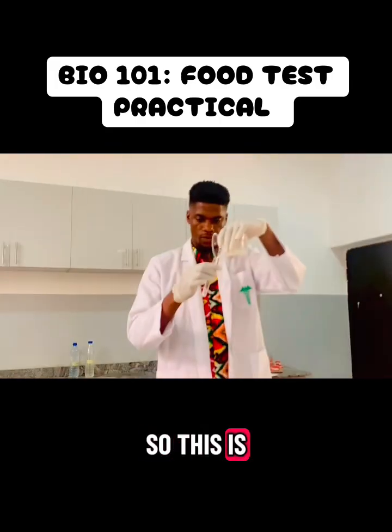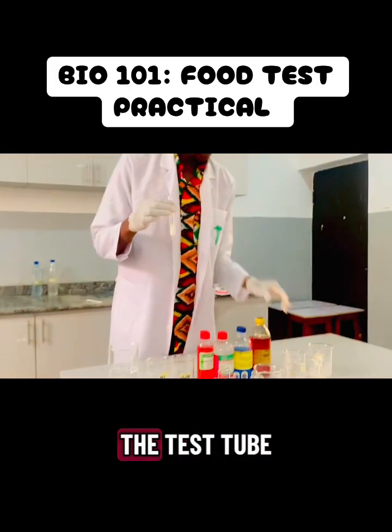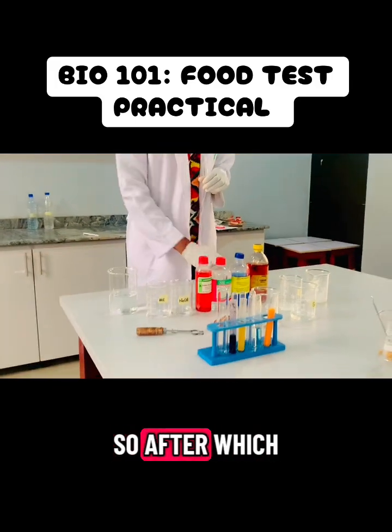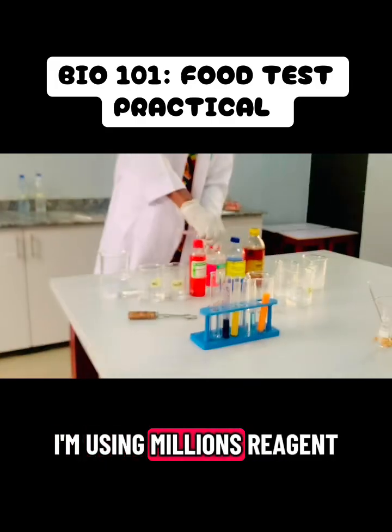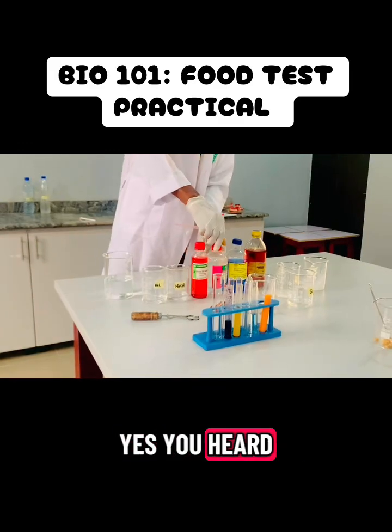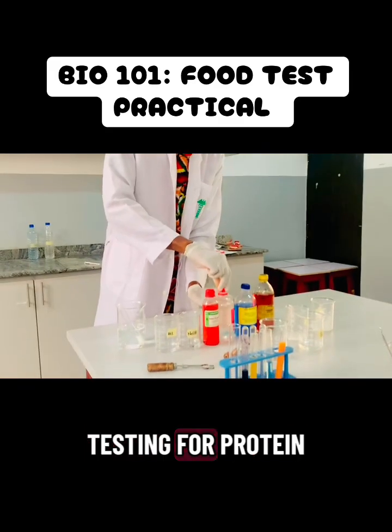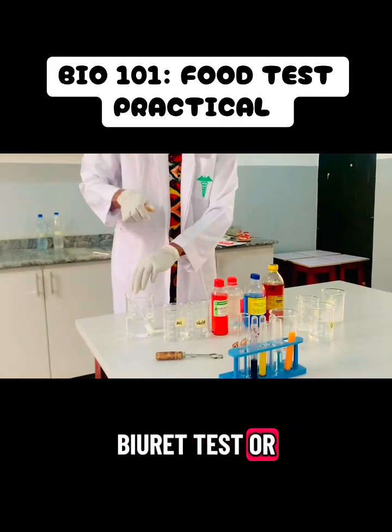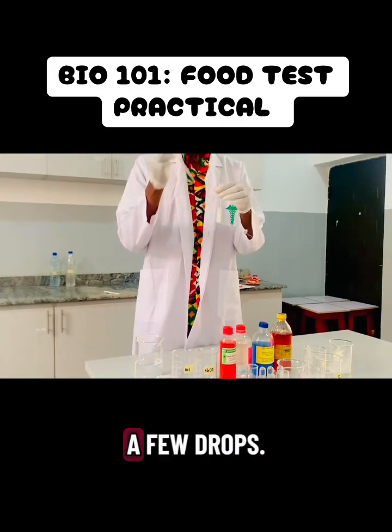Voila. So this is protein, and I am adding my food sample to the test tube. So after which I go in with my reagent. So for this, I'm using Millon's reagent. Yes, you heard that right. There are two major types of reagents when testing for protein. Either you use your Biuret test or Millon's reagent. So I'm using Millon's reagent. So I go in and add a few drops.